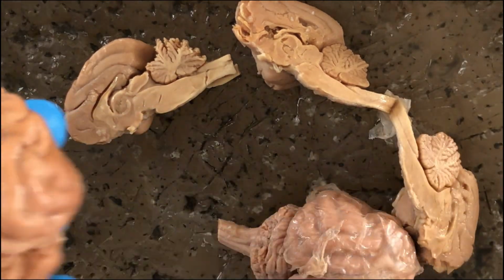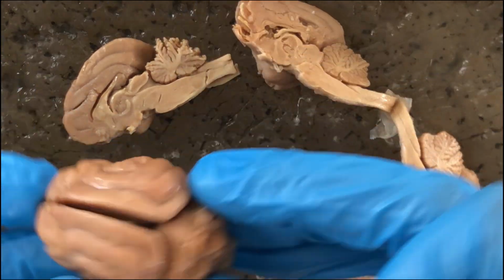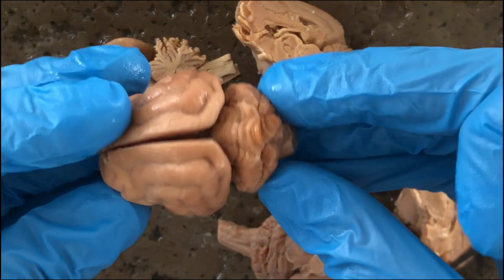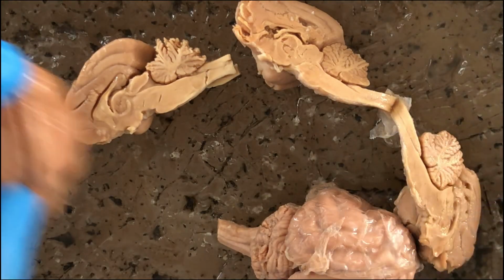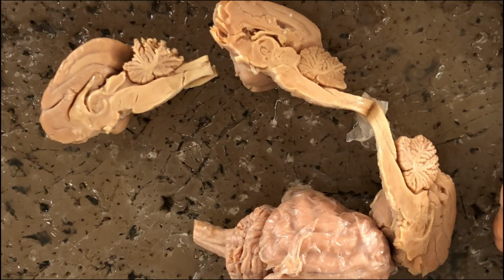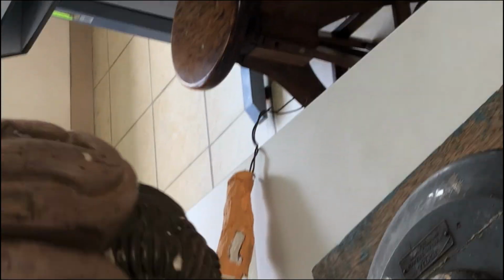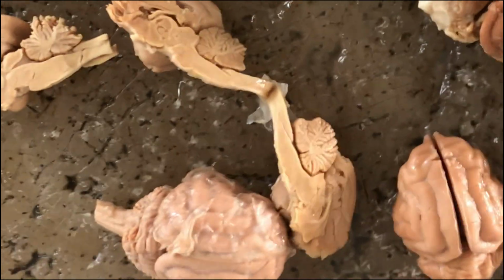And so we start first with the undissected, or just the superficial structures of the cat's brain, and then maybe we'll go to the structures that can be seen in our plastic model specimen located there, containing the detailed structures of the mammalian brain that cannot be seen in our wet specimens.